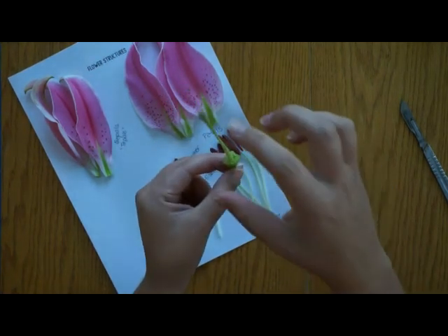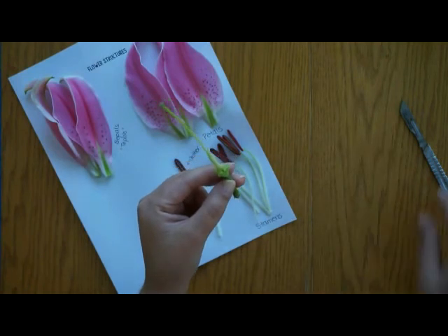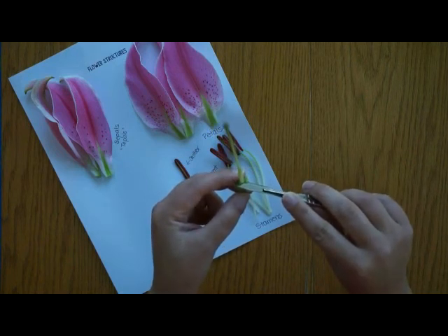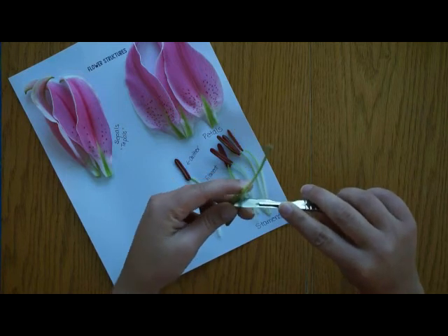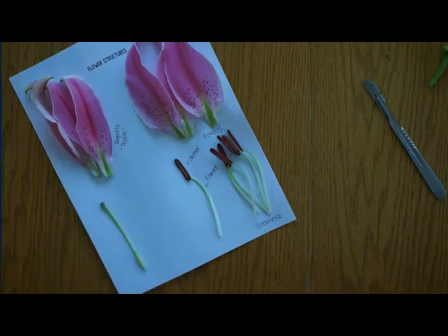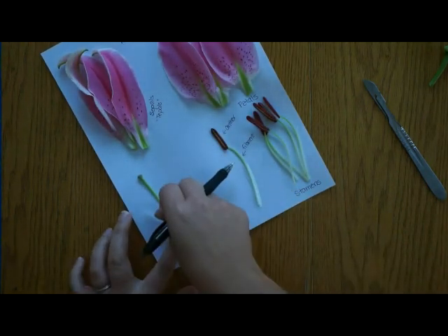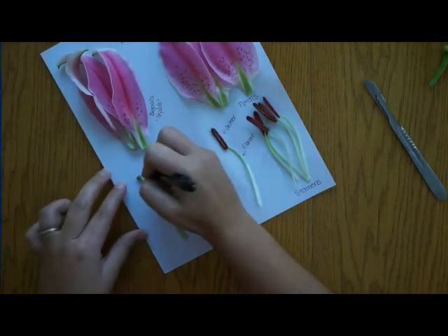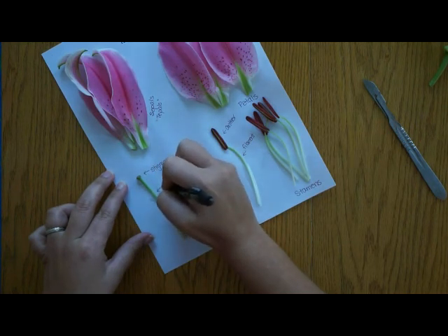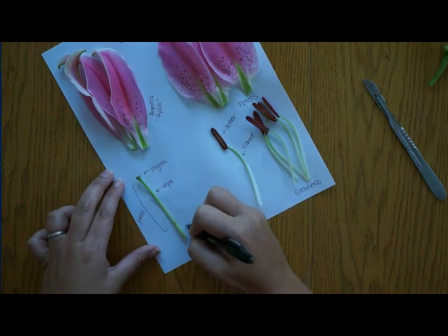Finally, we're going to look at the female part of the flower. It has a stigma on the top, a style which holds it up, and an ovary at the bottom. The ovary on my lily is not very big, but some flowers have much rounder ovaries that would be easier to see. We're going to cut the ovary off at the bottom where it attaches to the receptacle, then tape it down onto the paper. Label the stigma at the top, the style — the tall portion — and the ovary at the bottom. All of those are part of the pistil, or the female part of the flower. Read the description of what each of those parts do in your lab procedure.